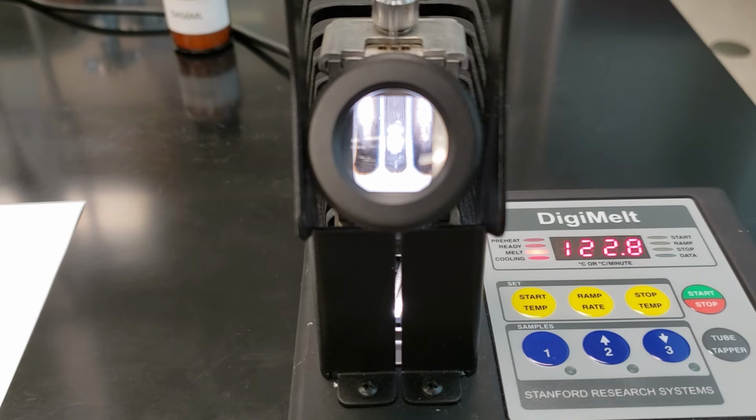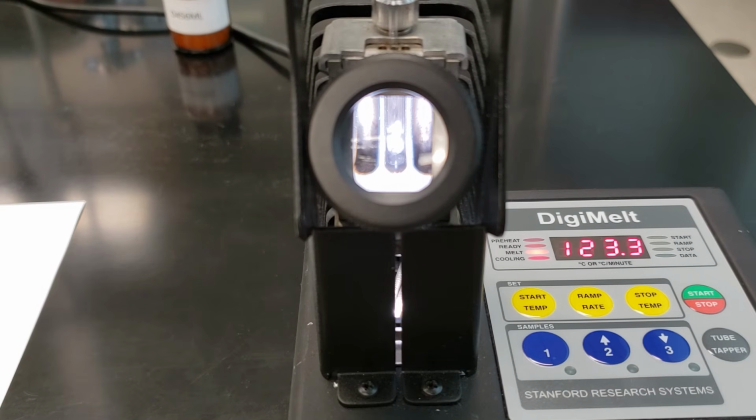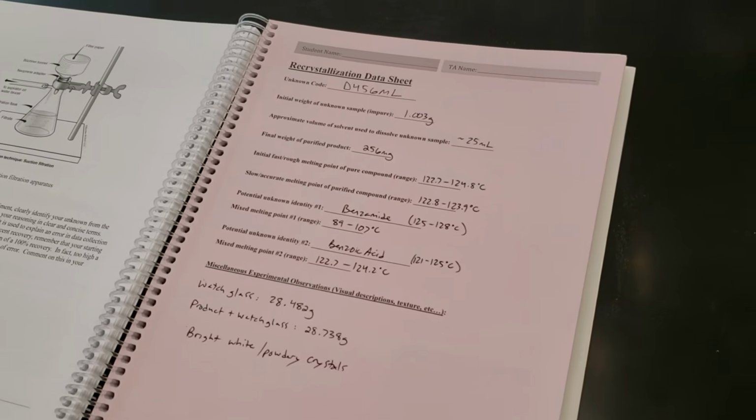Starting to see weeping in the center tube at about 122.7. Solid is slowly melting. Fully melted at 124.2. So we finished our experiment.